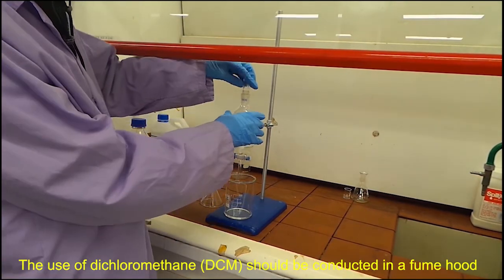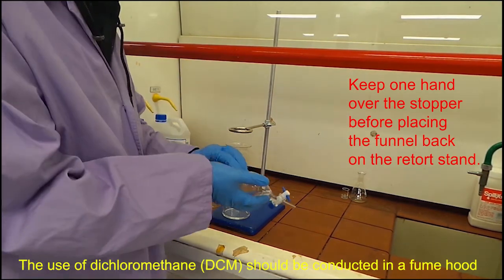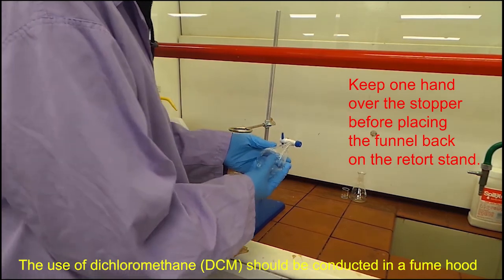Now you can place the cap on and give it a slight twist to secure it. Place the cap to the palm of your hand and point the tip of the separation funnel to the back of the fume hood.